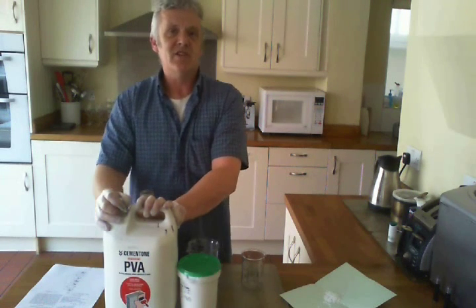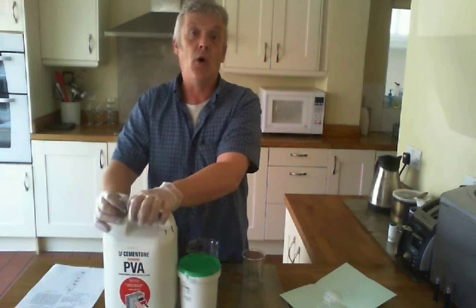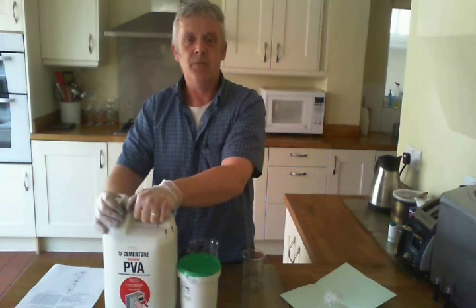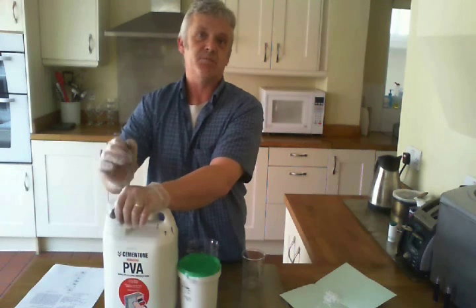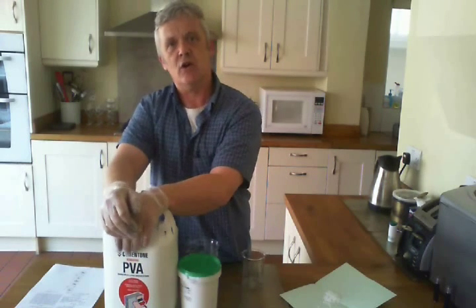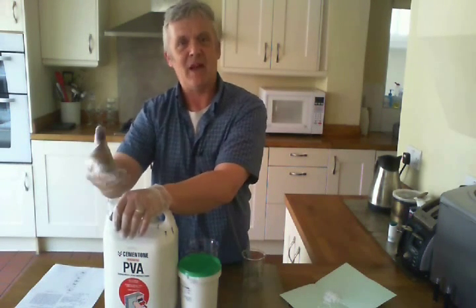The concentration of PVA you need is not amazingly critical. It can be polyvinyl alcohol, polyvinyl acetate, or a mixture of the two. The concentration in the electrolyte is somewhere between 1-20%, with the best results apparently between 5-10%. I'm going to make up a standard gel electrolyte that you would then modify for your particular battery.